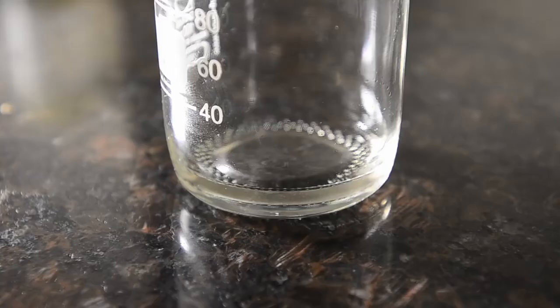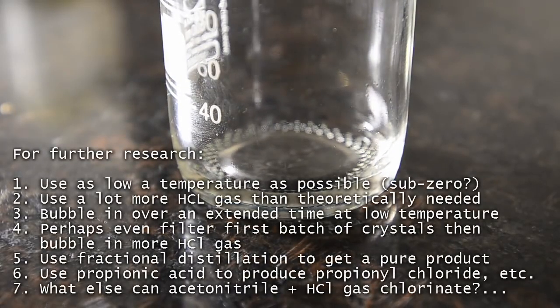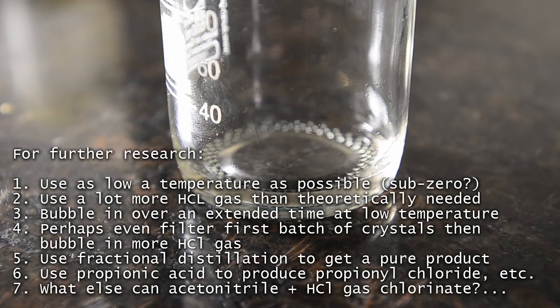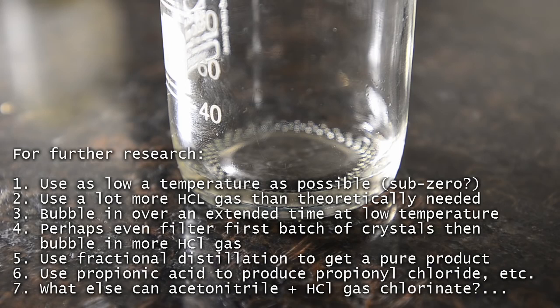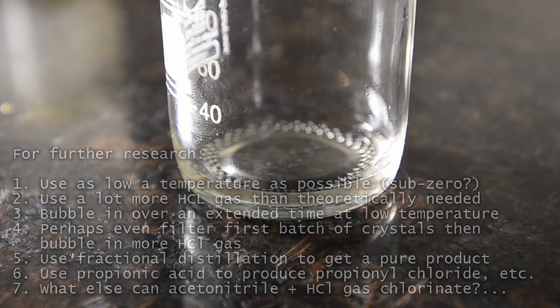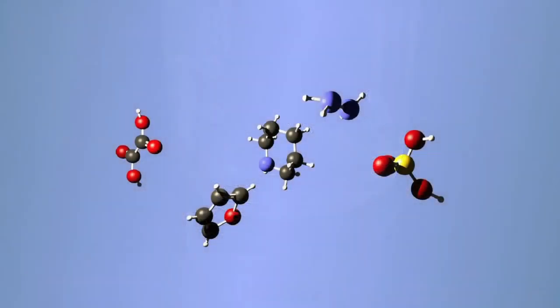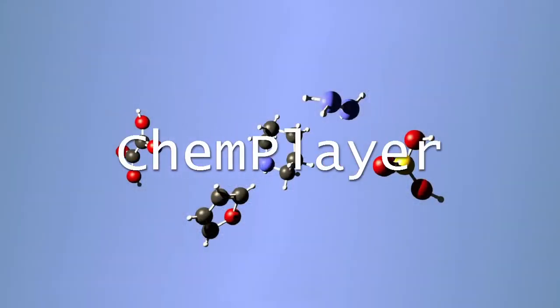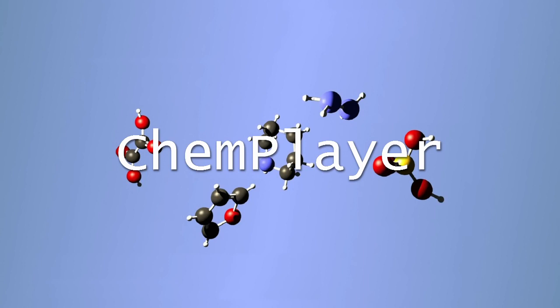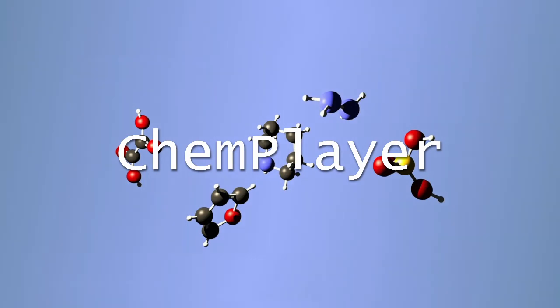So in summary, to our surprise this reaction actually does create a small amount of acetyl chloride which can be separated relatively pure. A bit of work is going to be needed to play around with this and see if the yields can be increased. To be continued.